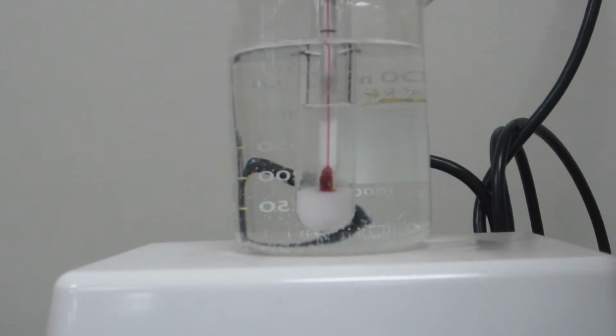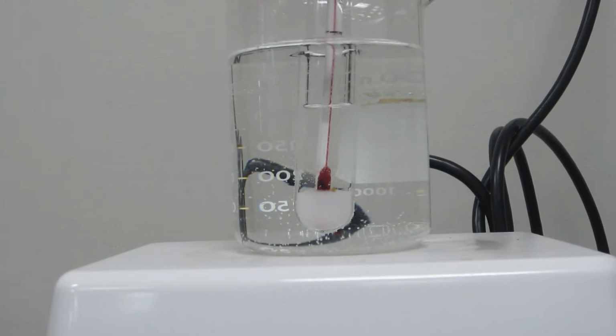Okay, and you can see I'm going to just use the thermometer to mix it up. That seems to work just fine for this experiment. And what we'll do in a minute, once we actually have the solid dissolved, we'll remove the test tube from the hot water bath, and then we'll monitor two things. We'll monitor the temperature, so the solution will start cooling off, start dropping in temperature. So that's one thing we'll watch for.